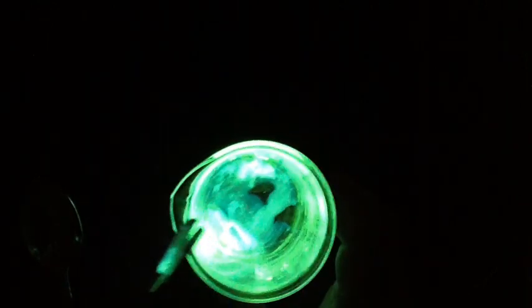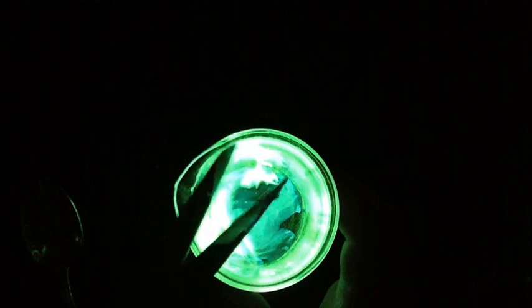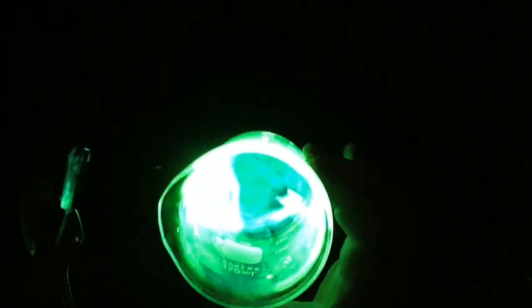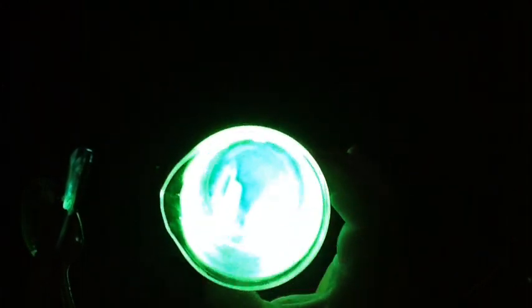In the beaker is a liquid with a capsule with another liquid. All right, write it down. Color change, light, turn on the lights. Physical or chemical? That's all.